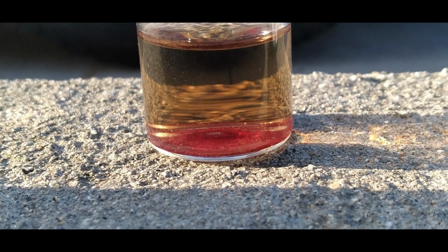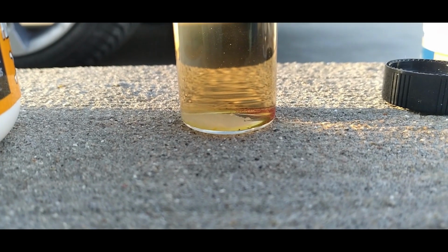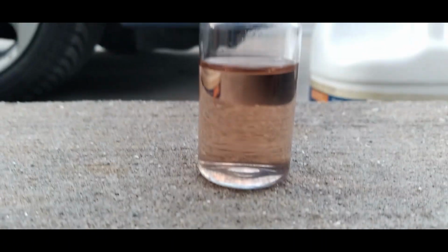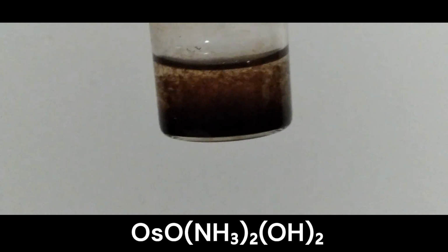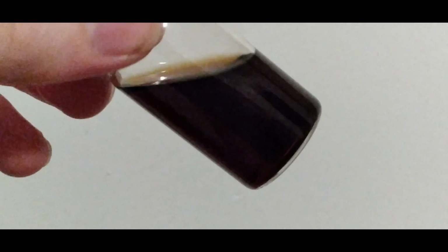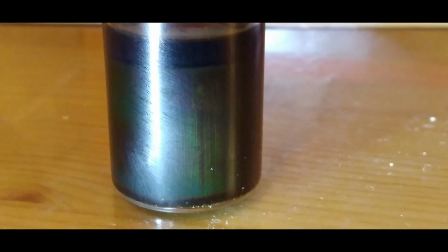Because the solution was already chock full of ammonium chloride, adding sodium hydroxide releases ammonia. Immediately, this produces a striking yellow color surrounding the solid sodium hydroxide. Slowly, the ammonium hexachloroosmate began to redissolve, and instead of the rest of the solution turning yellow, it turned a peach color. Only several hours later would it eventually turn back to yellow, before then turning brown and precipitating osmium diammine hydroxide. After isolating the first batch of osmium diammine hydroxide, I unfortunately haven't had any time to do anything else with the remaining solution, which has turned completely black and deposited a kind of osmium barcode on the side of the glass.